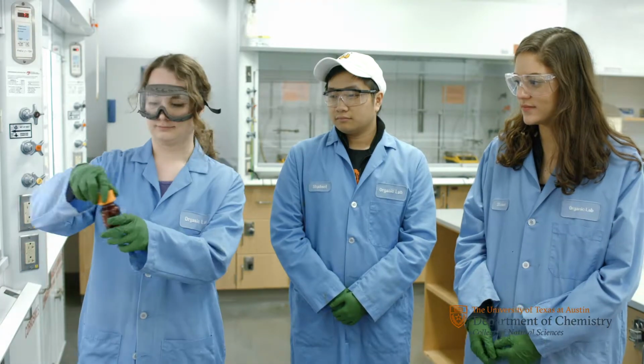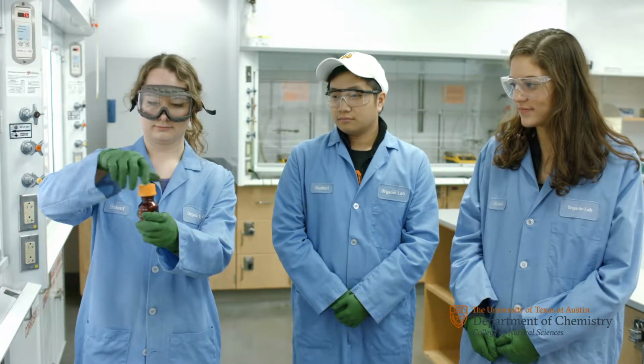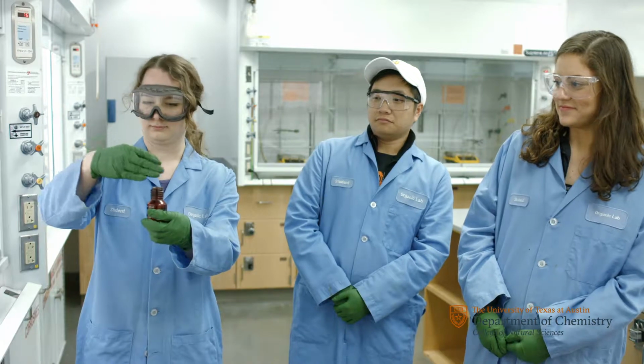Smell each carvone oil and describe the odor in your notebook. Remember to waft the odor towards your nose.